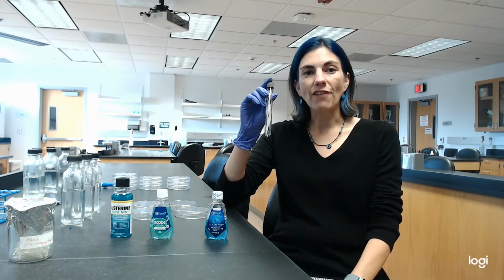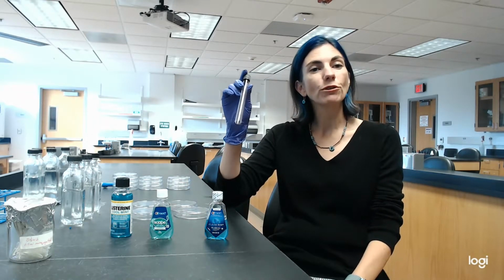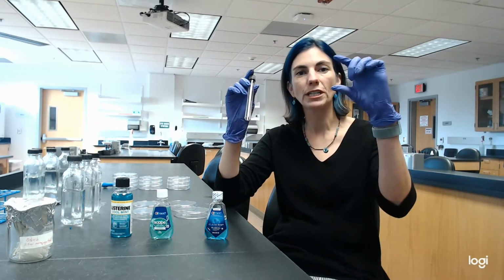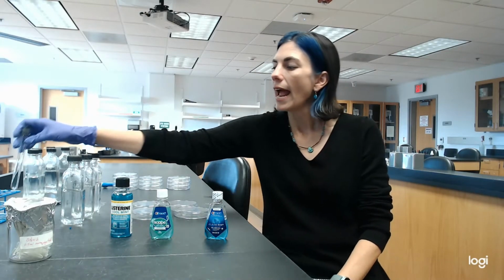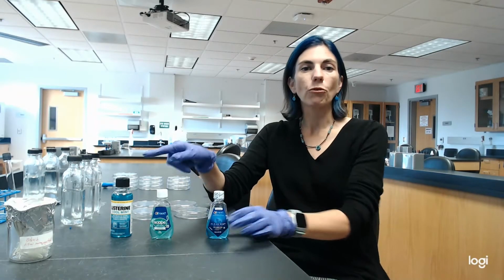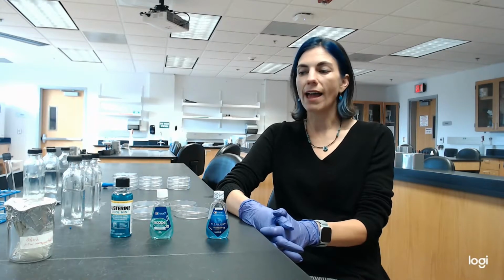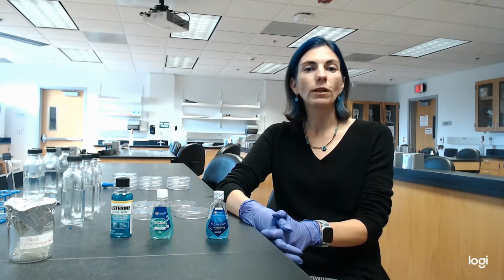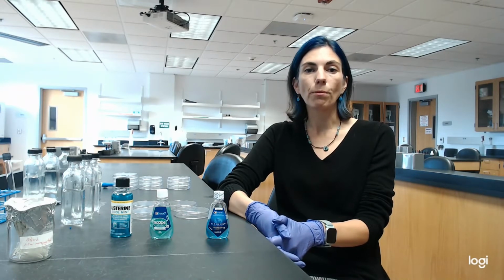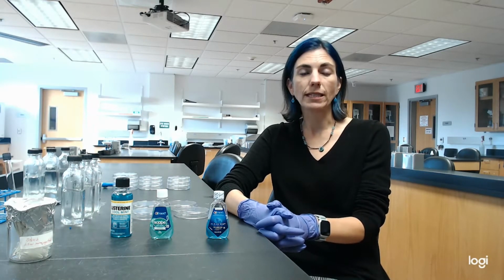Once I have that saliva, I'm going to separate it out into 4 small microfuge tubes, kind of similar to the ones that we used in Lab 16, the genetic engineering labs. They are pretty small tubes. And then I'm going to be adding some of the mouthwash to each tube. I'm also going to have a control where I have some saliva with just water. That control will allow me, or allow you, to analyze the number of countable and platable microbes that I started with in my saliva.